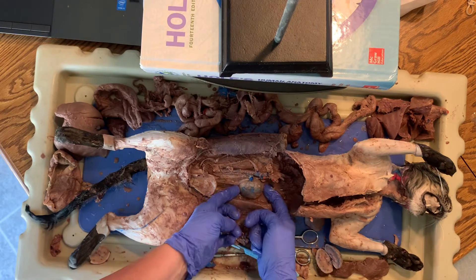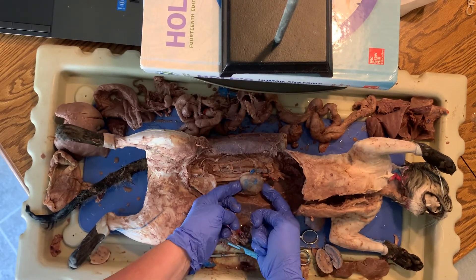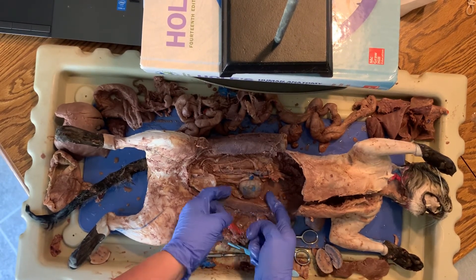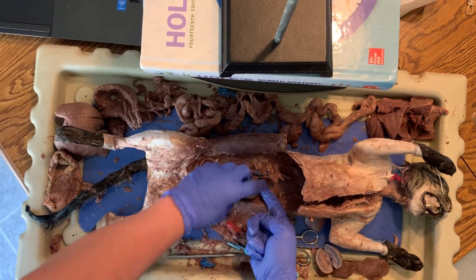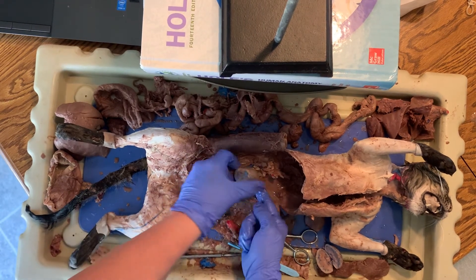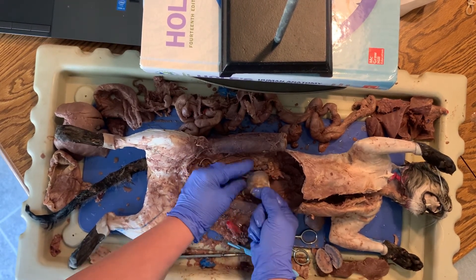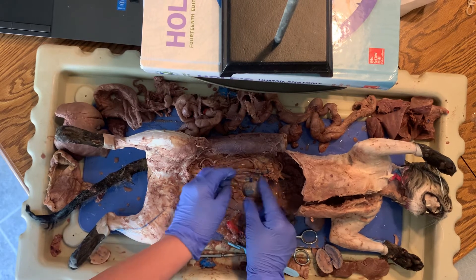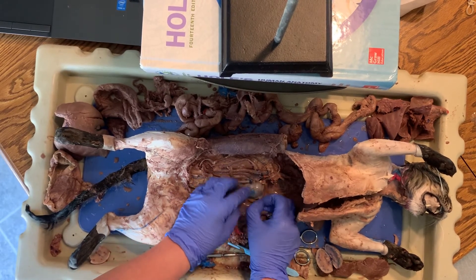The other kidney is here, and again they're really stuck inside that cat — they don't move. There's lots of connective tissue holding it in; you have to kind of dig to find them. They're hidden under lots of fat.